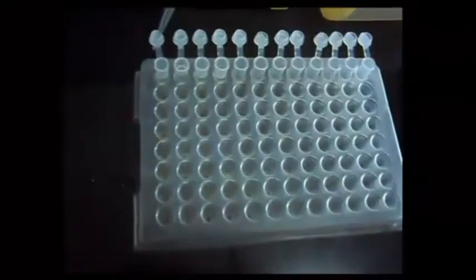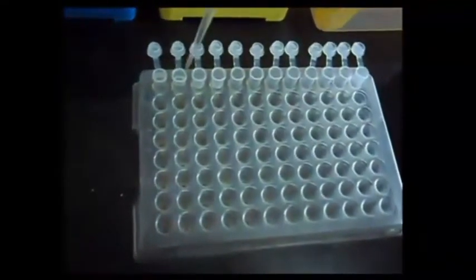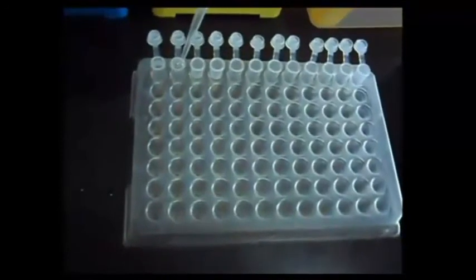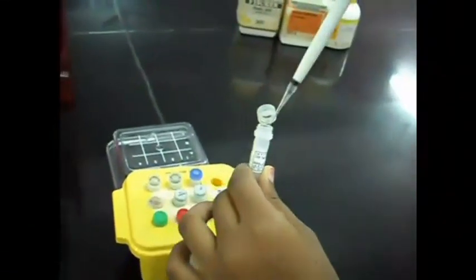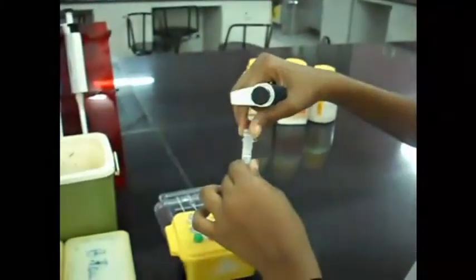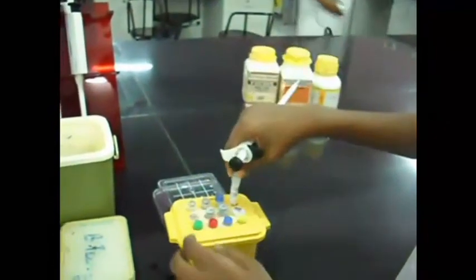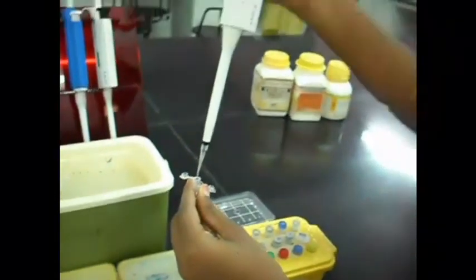Don'ts. Do not add the ingredients without refrigerated condition. Do not use the same tips again and again without discarding. Do not handle the samples with bare hand. Do not take the PCR tubes outside the ice box while adding the ingredients.